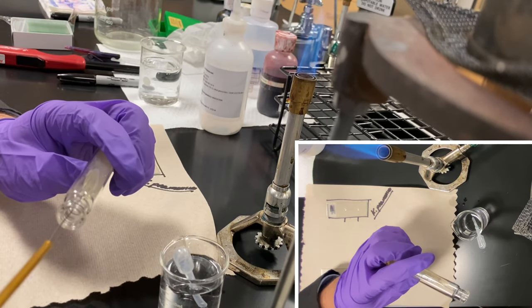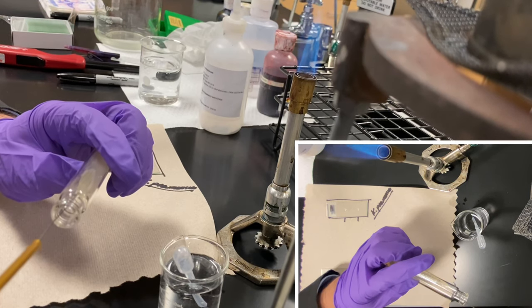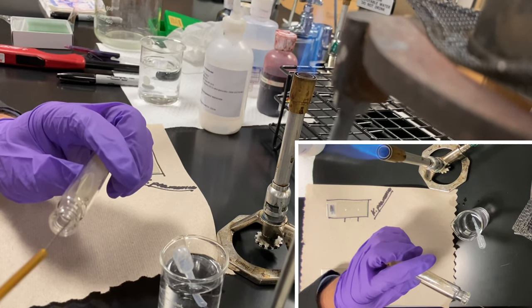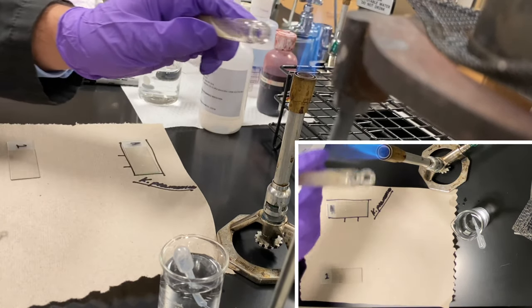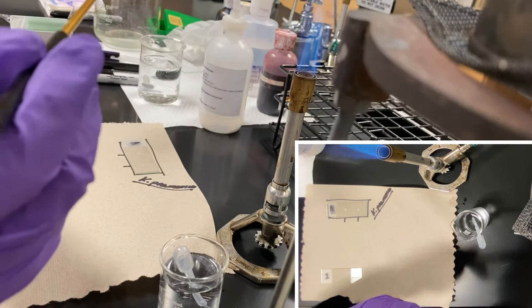All I'm going to do is just a gentle tap. I'm not scraping, I'm not carving, I'm not poking. I'm just tapping a little bit of the stuff that is in there. I'm going to pass my substance again, all this with the pinky technique, to close it.